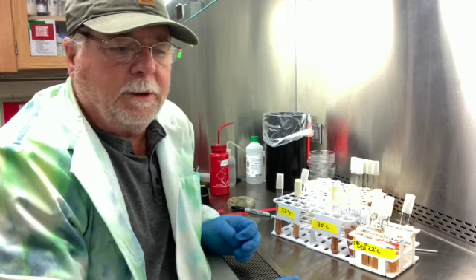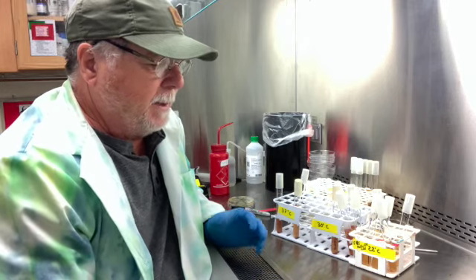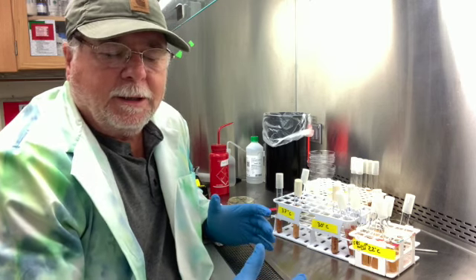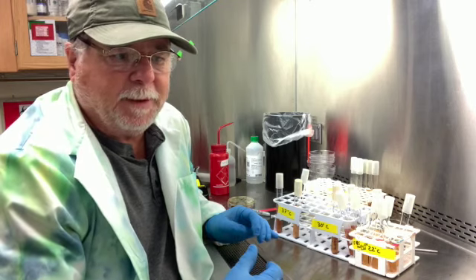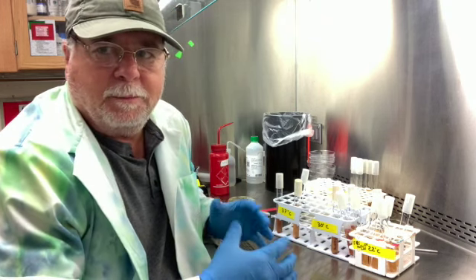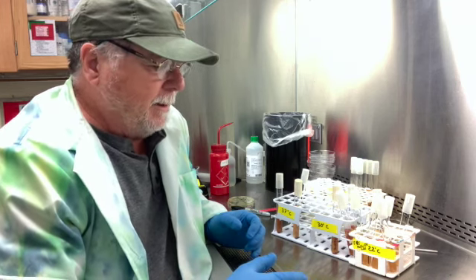Hi class, we're going to look at the motility agar results. When you look at motility agar, because there's less agar in the media, the bacteria can swim through the agar, but it doesn't allow it to sink out of the media because it is a little bit thicker. So this is going to tell us whether it is motile, or able to swim, versus non-motile, not able to swim. And then the second aspect we can look at is where it's growing.